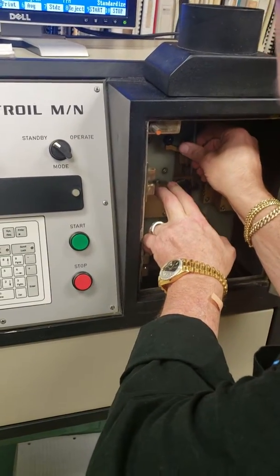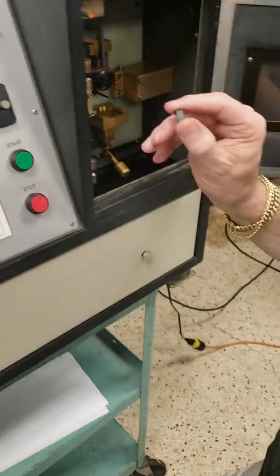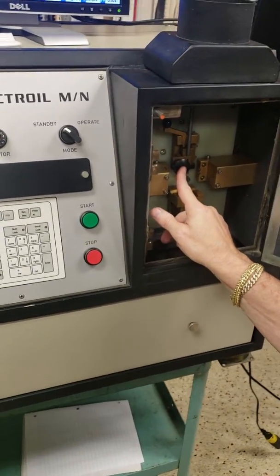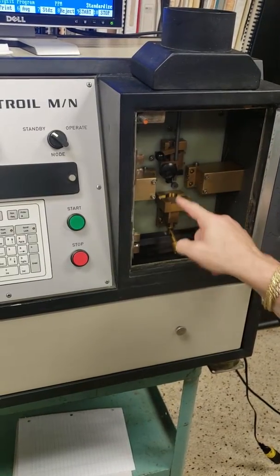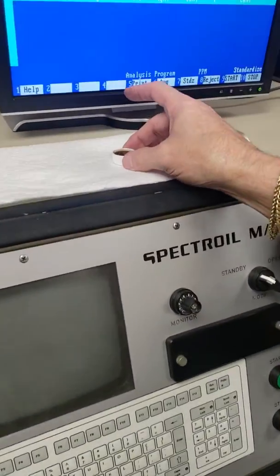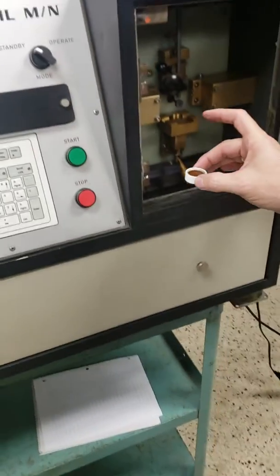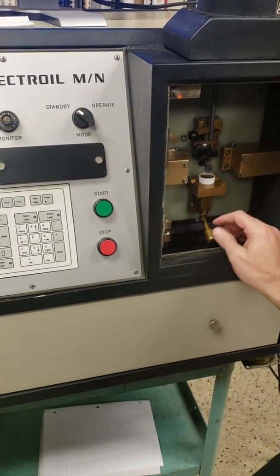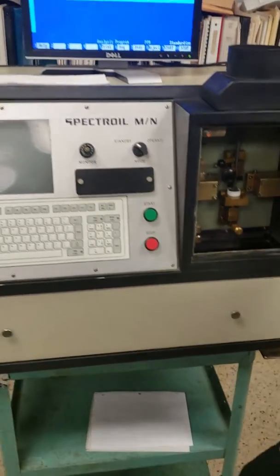So you slide the rounded end, and then you get these little carbon discs, and you put one in there, push it on there tight, and then pop that down so it touches, and then when you drop this down, that creates a gap. And then this is the stand for your oil. We've already poured a sample of oil. This is 100 parts per million. You'll put that in there like that. And you'll raise up the platform, and it'll dip into the oil right there.